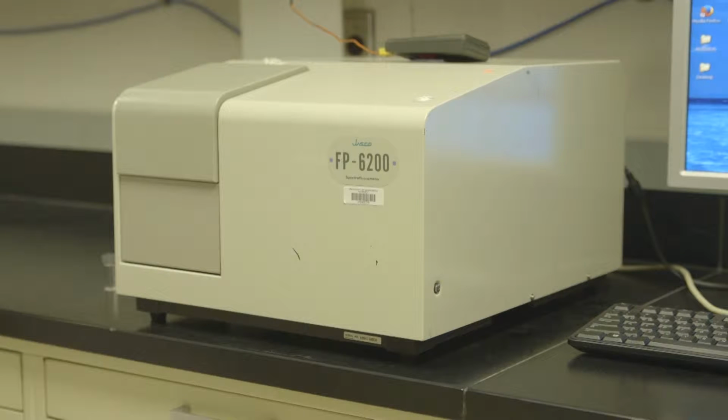There are two shutters in the sample chamber, the excitation and the emission shutter. The excitation shutter blocks your light source from reaching your sample and degrading it. The emission shutter blocks light from reaching your detector. If you aren't taking measurements, these should be kept closed.